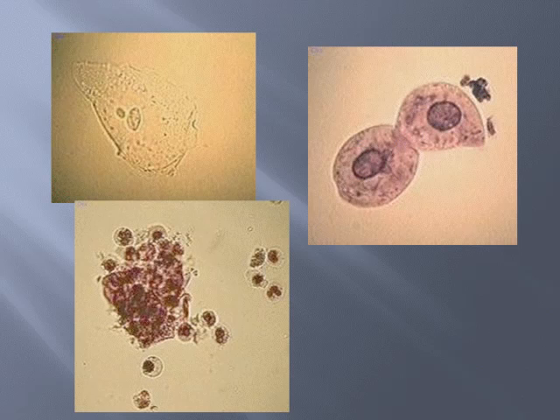This slide here is of transitional epithelial cells. They're usually fairly round, and a lot of times you'll see a number of them together as well. These small ones down here are the renal epithelial cells, and they are smaller than any of the other epithelial cells that you'll see. Some laboratories do not differentiate between renal and transitional epithelial cells. They just call them round epithelial cells.